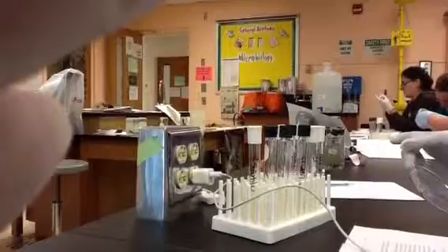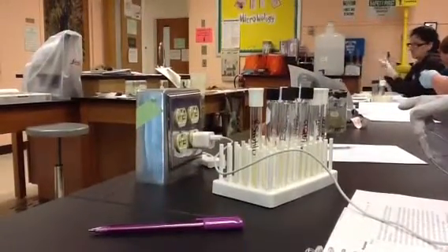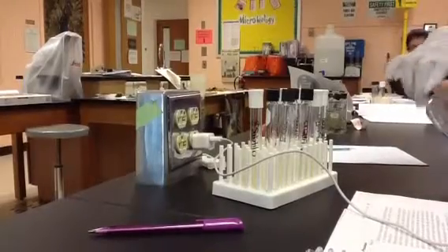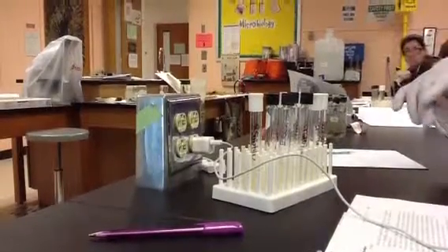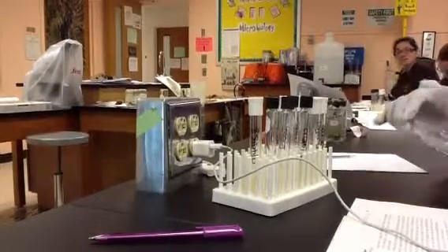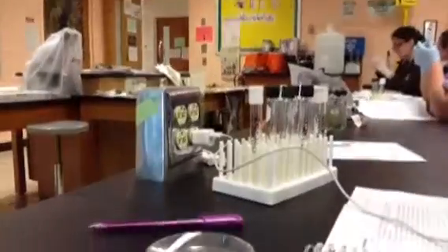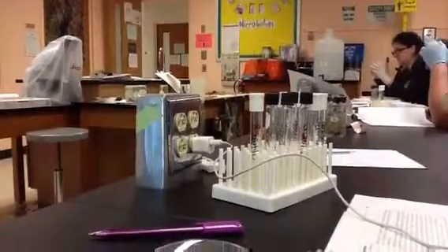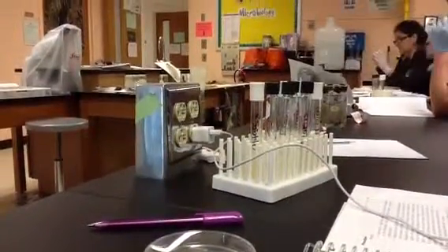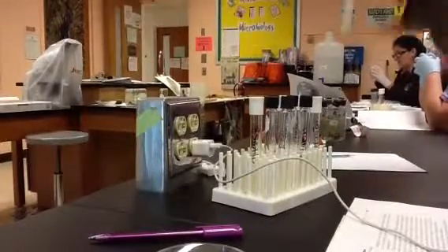This is the one that has no bacteria in it. That would be no growth, that one's perfect. We probably don't have any that are cloudy. Any other questions on either of those labs?